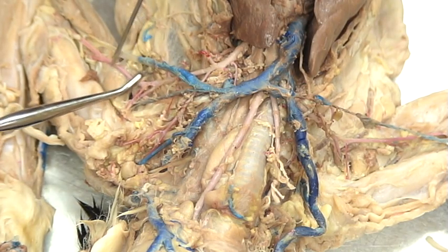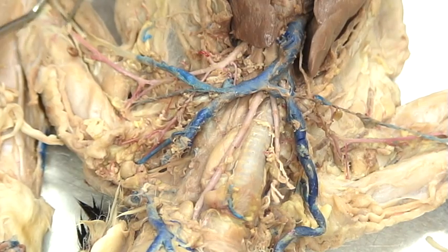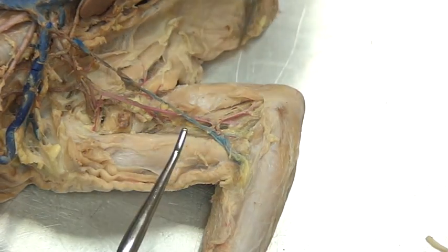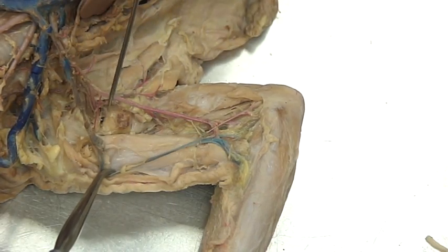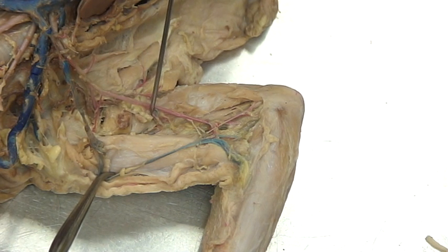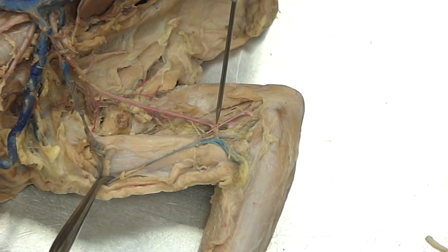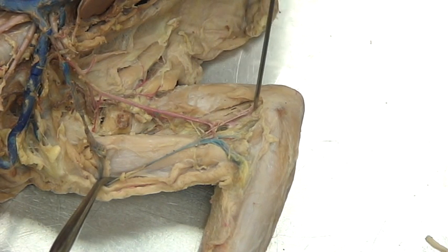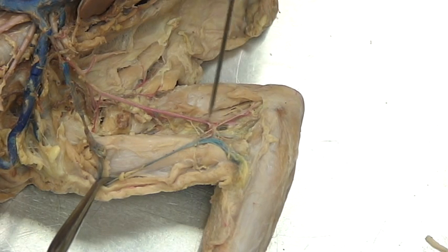After that circumflex, we're going to find that the axillary will become a brachial. That will follow just like — if I slide over to the cat's right — this was developed a little bit better for the vein and the same holds true for the artery. Here is your circumflex right here. So that means after that point this is all brachial, and it will specialize into the pinky side as well as the thumb side — so this is going to be the ulnar as well as the radial.